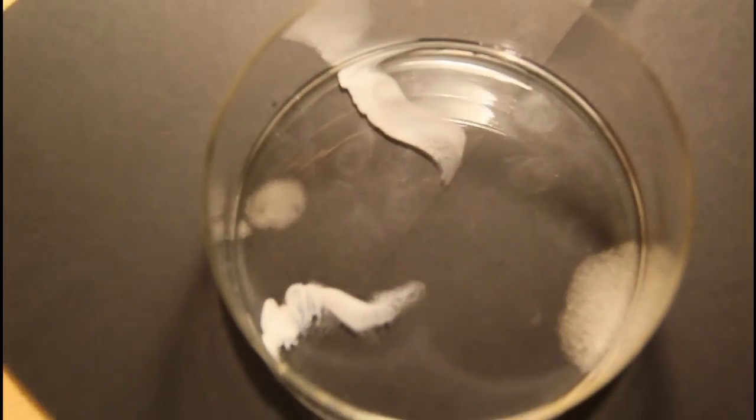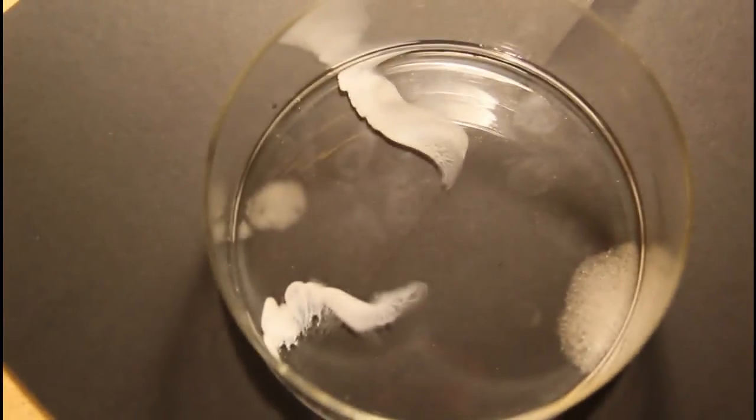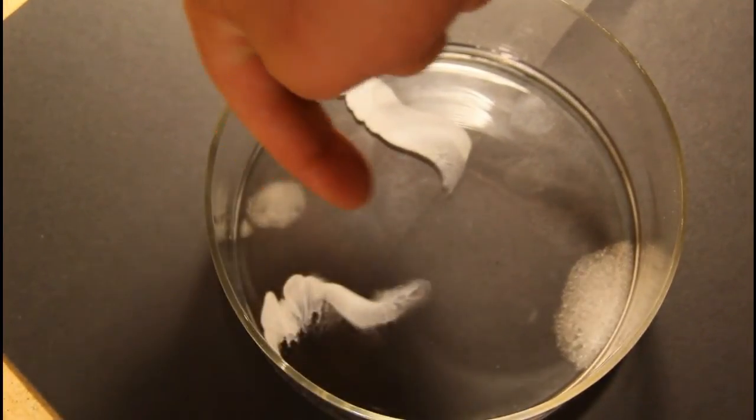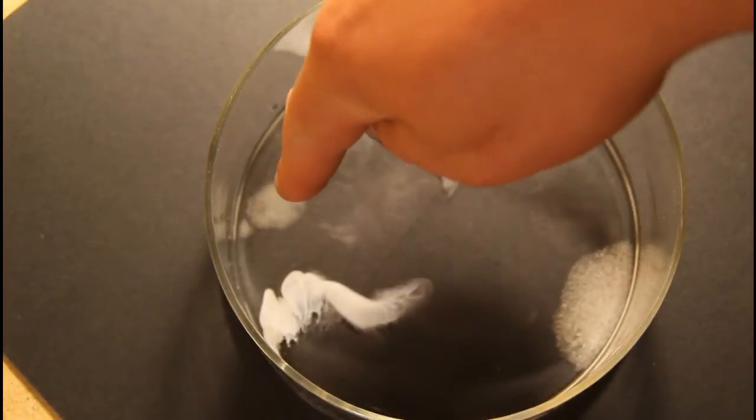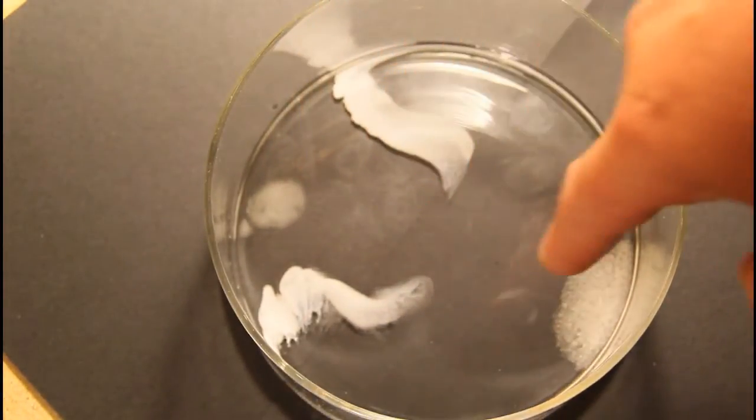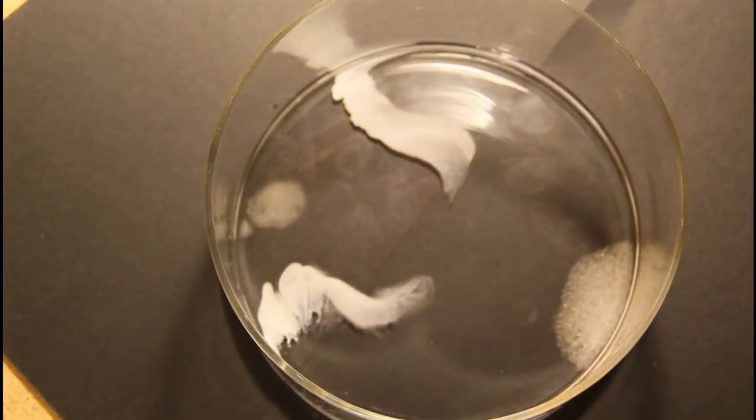The precipitate is forming as the silver ions are heading this way. The chloride ions are heading this way and the silver ions are heading back that way.